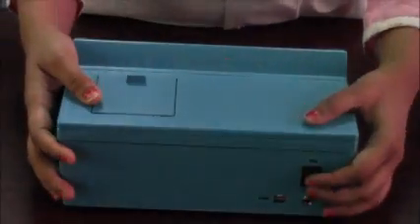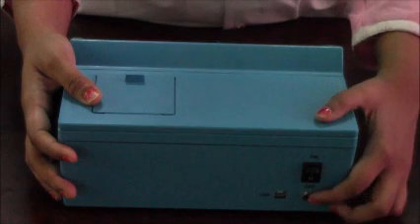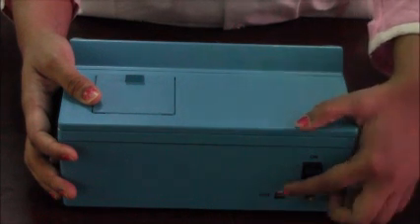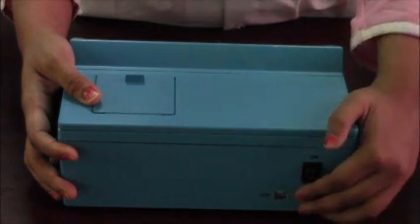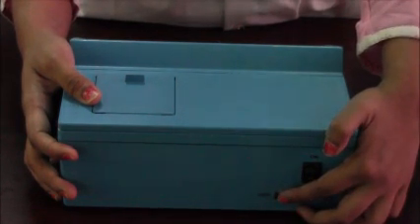On the back panel of the meter you can see the on/off button. Below you can see the power input connector, and on the side you can see the USB connector.